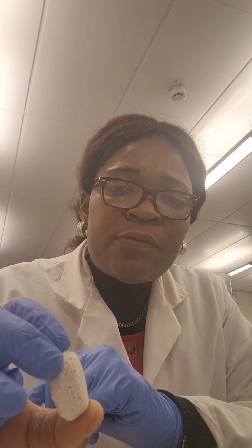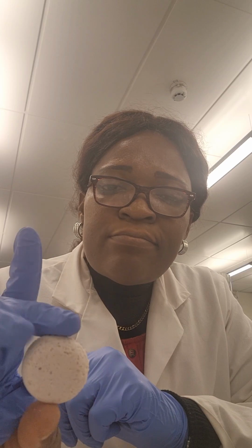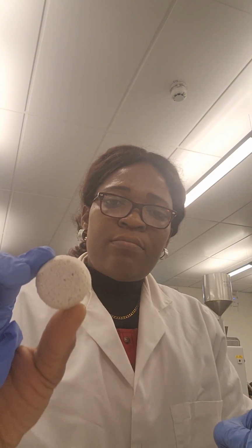And of course, we expect the color change. You see the next one melted at 1000. Of course, while temperature increases, viscosity should reduce, meaning bubbles should leave the surface of the melt more easily. That is what you're seeing. But I want us to pay attention to why the color is changing from what we saw initially, very pinky, to this one that is looking lighter.